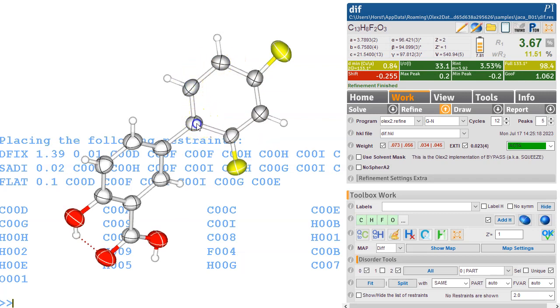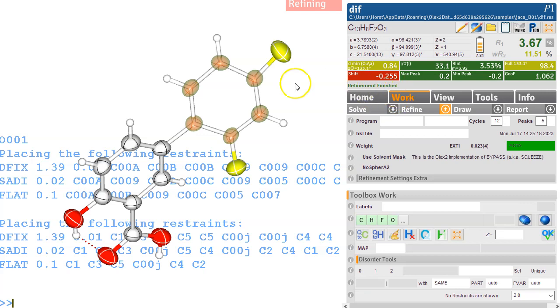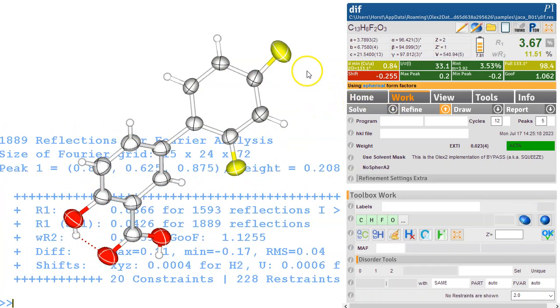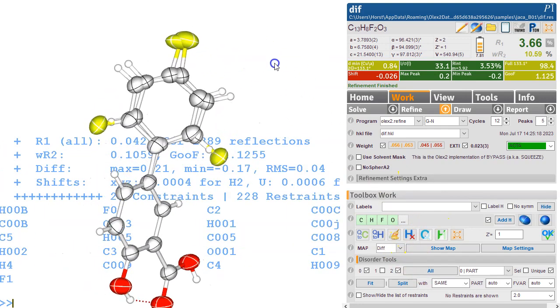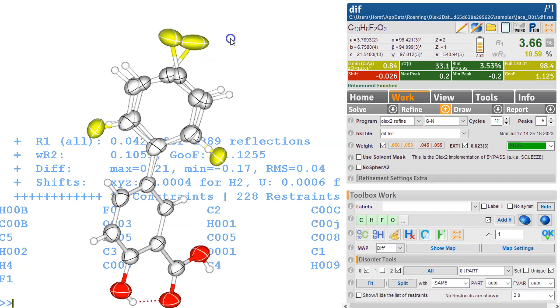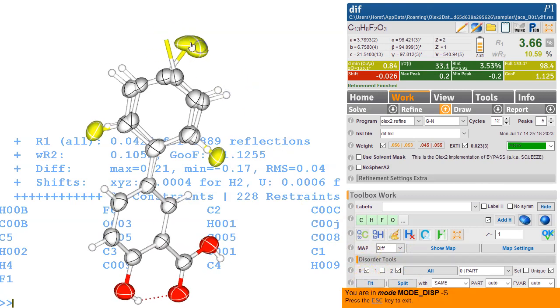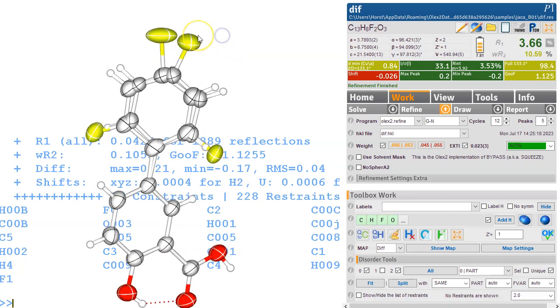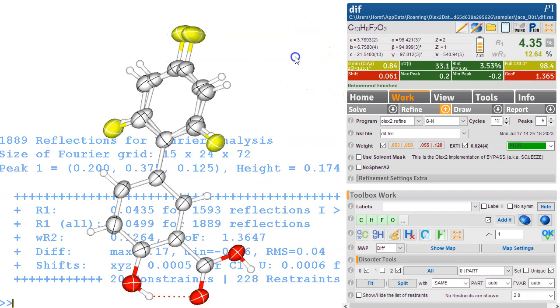I think we need to actually align, click them in order. So I'm selecting these 6 in order and repeating the command. So hopefully this keeps those hexagons happier. The fluorines, let's just check whether they've still got this strange sort of crossing over here. So let me just cross it over properly. So I'm going to fit. I'm going to move that over there and that over here. And no, that's not what I wanted to do. Let's just go back. So this over here, and hopefully they'll sort themselves out and go into a sensible position. Yes, they do. Okay, so this is not looking too bad.